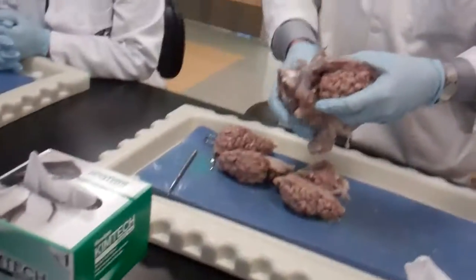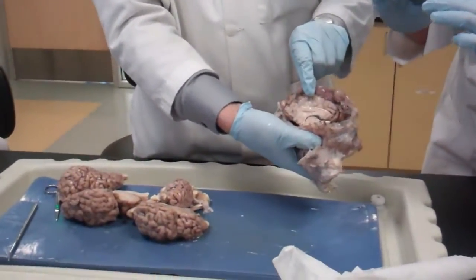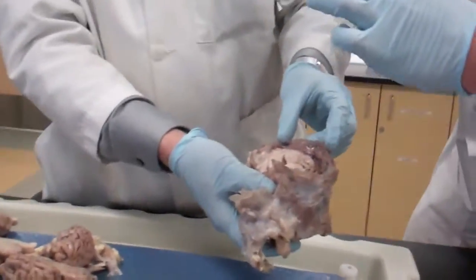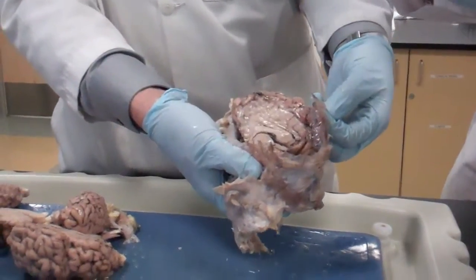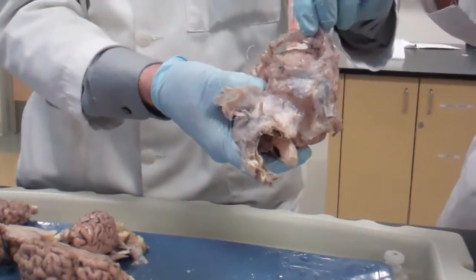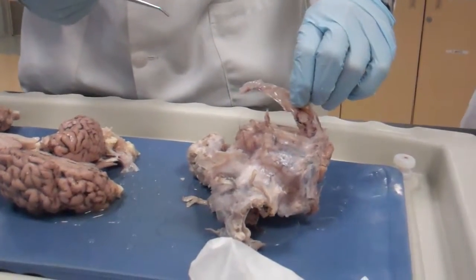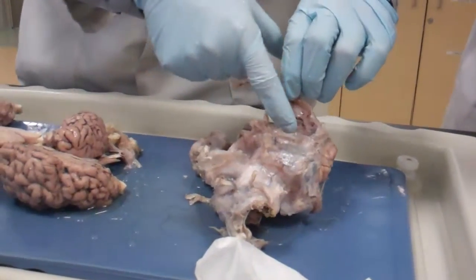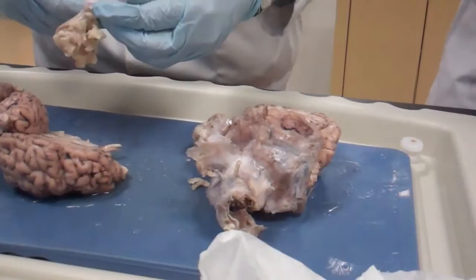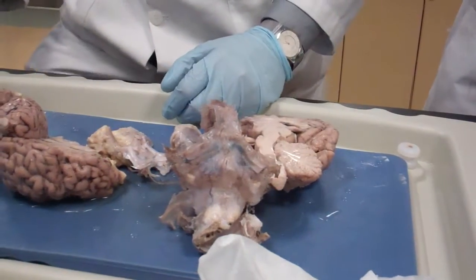I put it on half the brain, obviously, because I cannot put the other half. You can see very clearly the falx cerebri. That's the same picture you've seen, and you have the inferior sinus right here underneath and the superior sagittal sinus on top. If you open this into two, you will be seeing the triangular area of the superior sagittal sinus. You're not going to see this on your brains. So the whole thing that's sharp is called the falx cerebri. You should have it — you're going to see it in a moment on your brains.